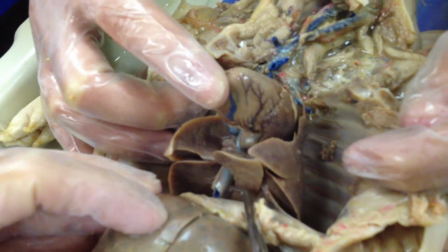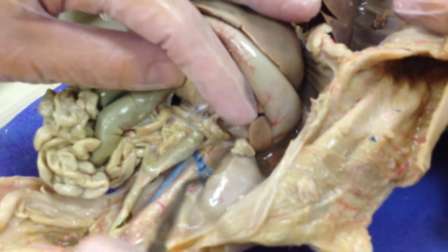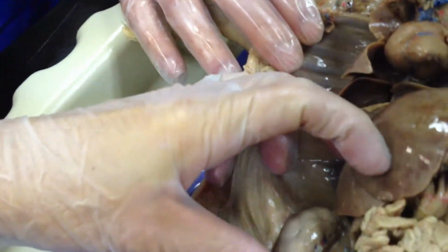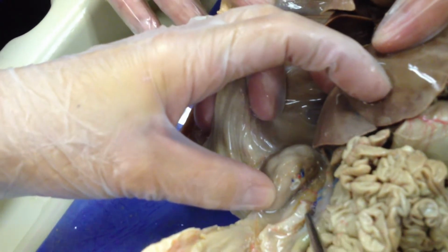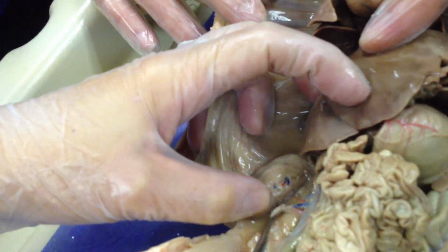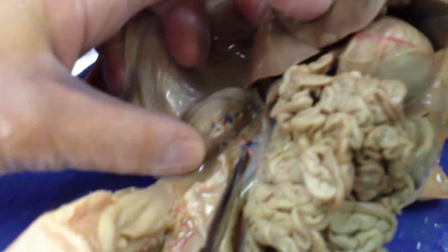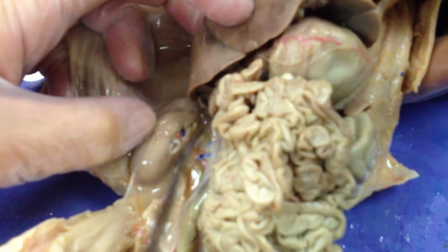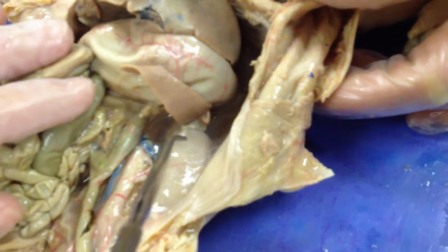Okay? Renal artery. So here is the kidney, and there's a renal vein that you can see on this one. On this kidney over here, it's a little easier to see. Whoops. It was a little easier to see, but I guess I cut it. You can see a little bit of pink right there. That's your renal artery, and this was your renal vein. And you can see them here. So I am very likely to use this little pig, in which case I would just be tagging the renal vein. All right?